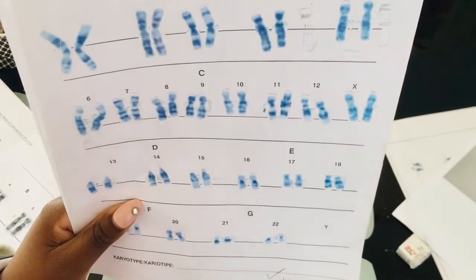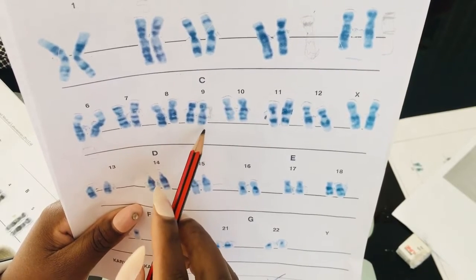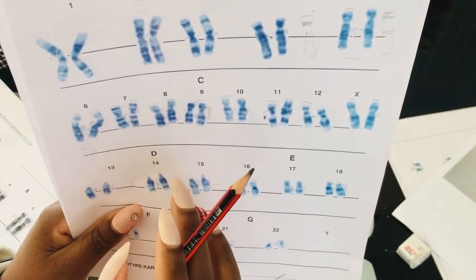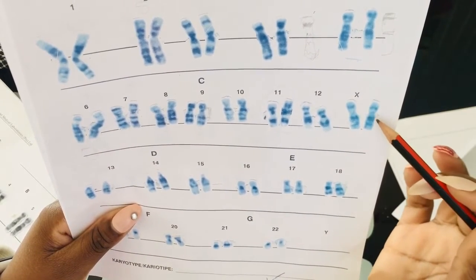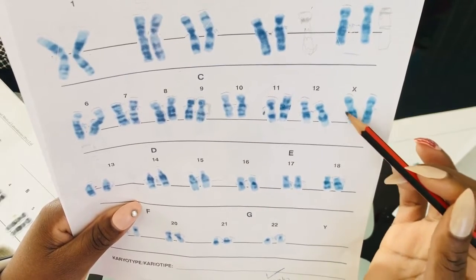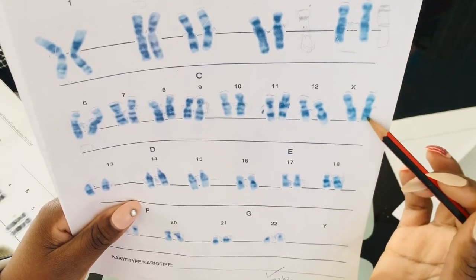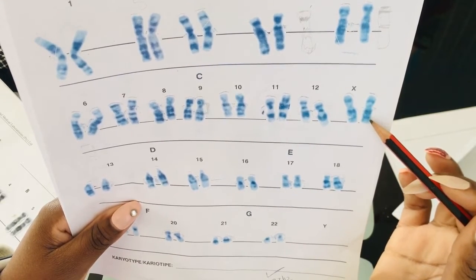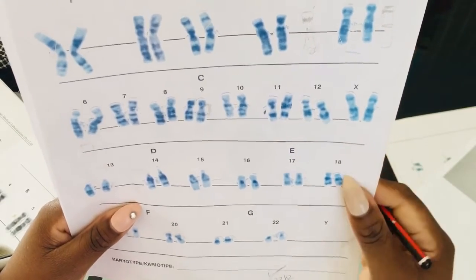you're going to remember that when it comes to chromosome 9, these two dark bands that are on the Q arm, they are kind of close to each other. But on chromosome X, they're apart. So we have our sunglasses, we have our bikini, and then we're going to have these other bands. But these two bands will be a little bit apart.